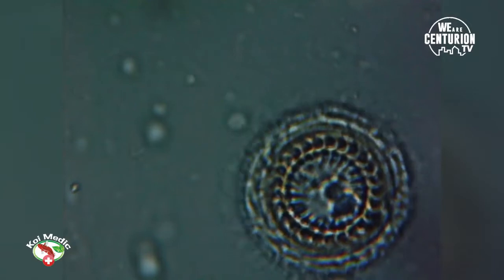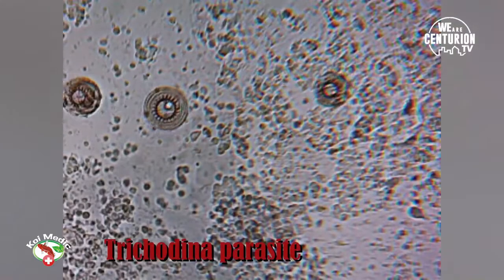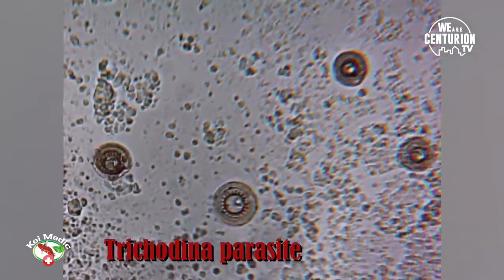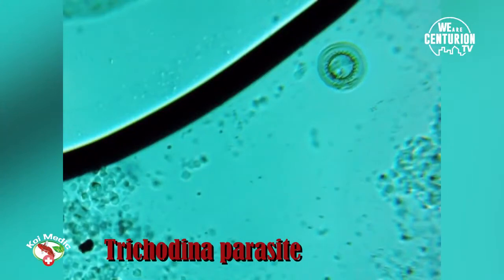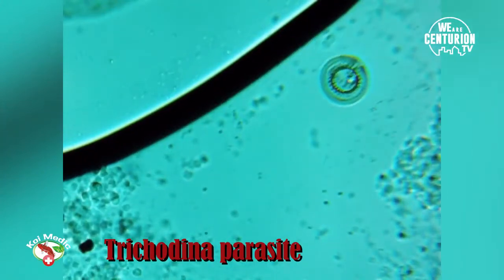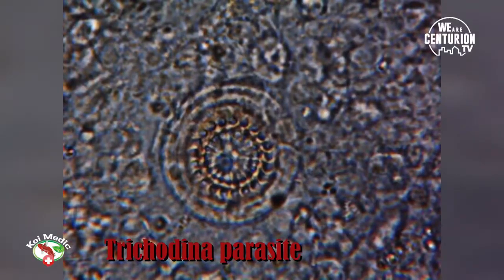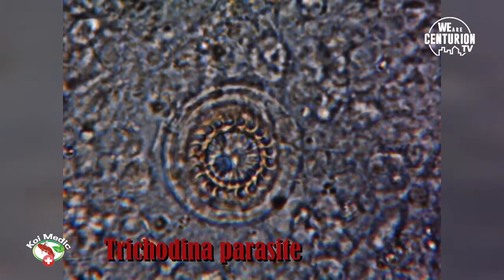Right, so in that instance the parasite is Trichodina. Trichodina is quite a nasty one — as you saw in the film clip, as it turns around it is essentially eating away at the flesh, almost like a saw blade cutting into wood. That same principle is why it moves around like that.